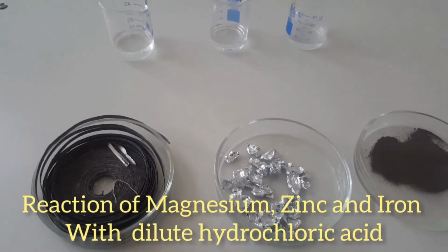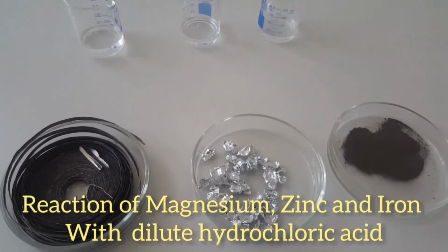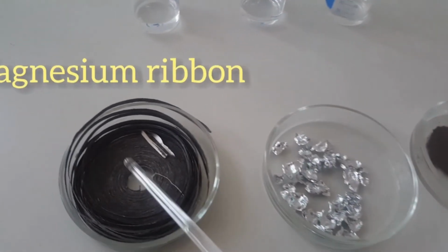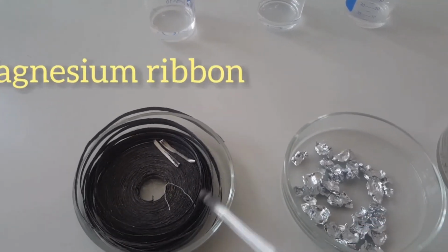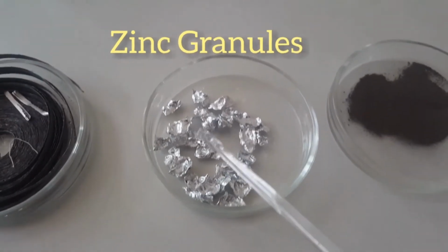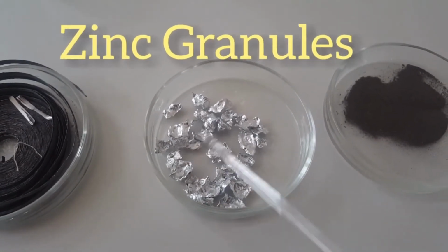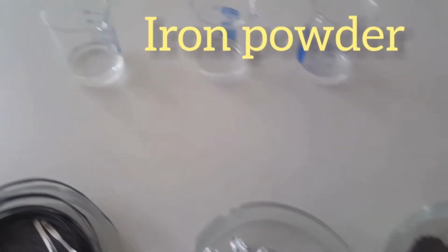Now we need to take a piece of magnesium from this magnesium ribbon. So that is magnesium ribbon. Take a small piece of magnesium from this magnesium ribbon, and when you look at the zinc granules you can see it's silvery white in color, and iron is obtained here as iron powder.